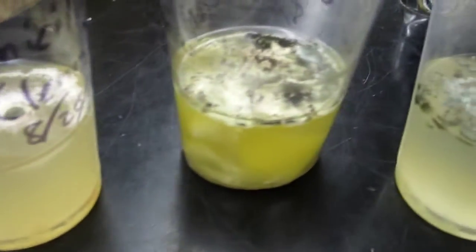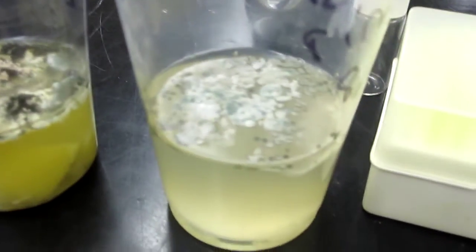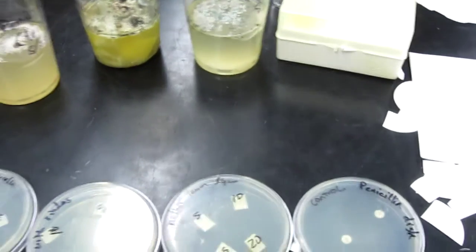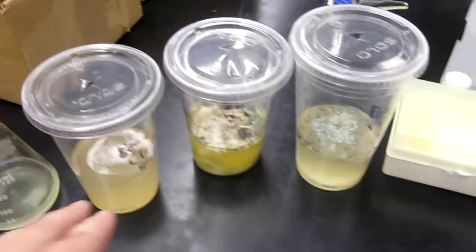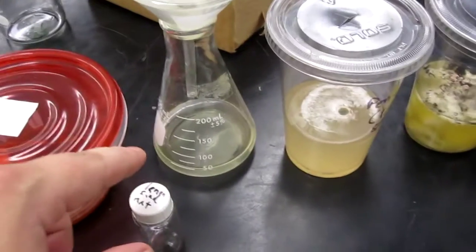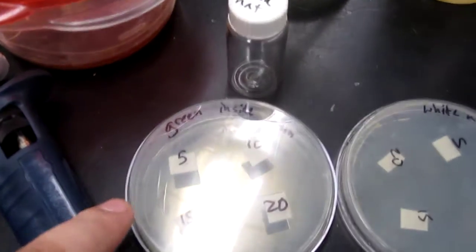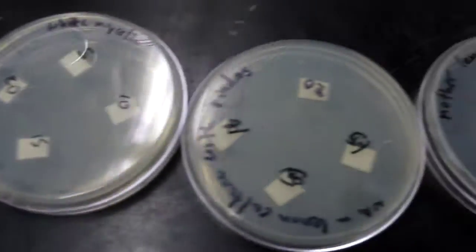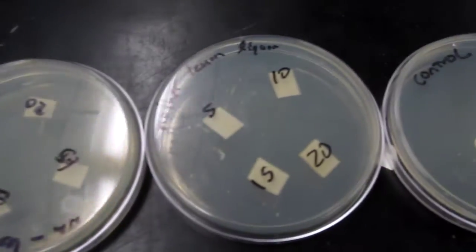After inoculating coffee cups filled with boiled lemon juice into three different containers, I've ended up doing liquid cultures, taking a sample of the liquid from each of these, filtering it, and then putting 5, 10, 15, and 20 microliters onto filter paper.